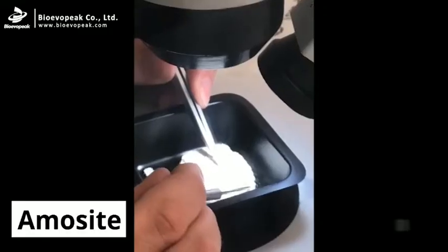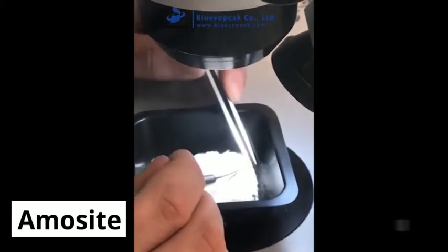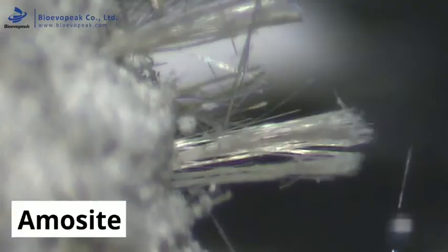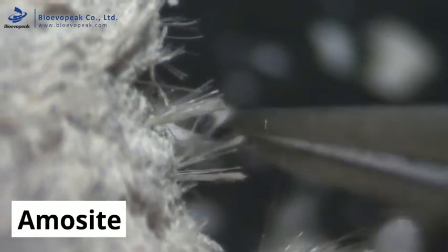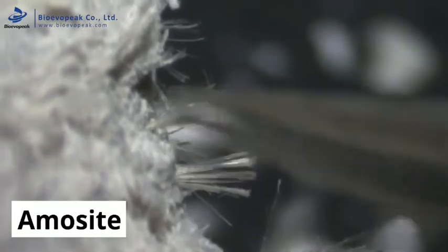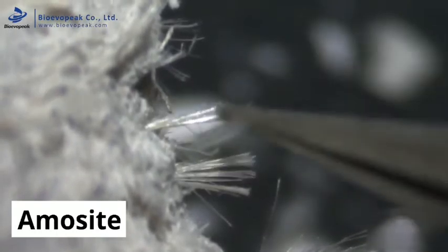Amosite, or brown asbestos. Here you can see a sample of suspect insulating board. Firstly, the sample would be prepared and then assessed under the stereo binocular microscope. The analyst searches through a sample to locate and identify suspect asbestos fibres. Having identified the presence of fibres, the analyst assesses their morphology, or shape, to ascertain if they could be asbestos, and if so, which type of asbestos it is most likely to be.